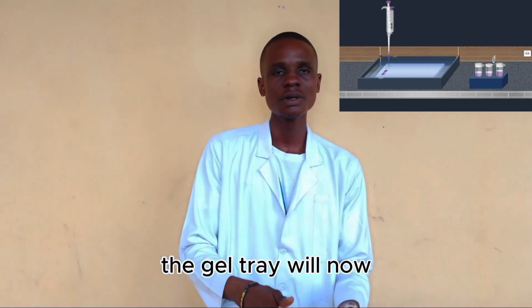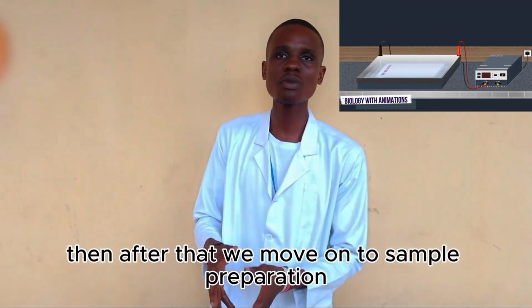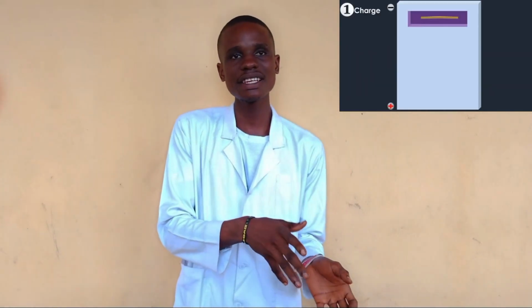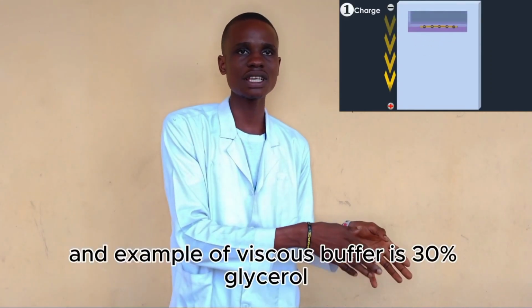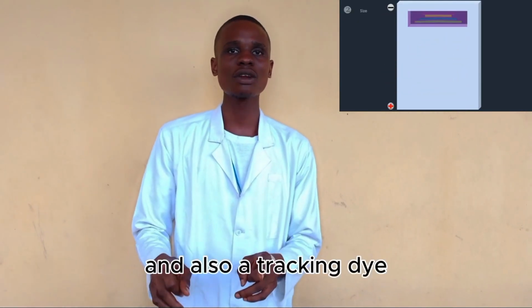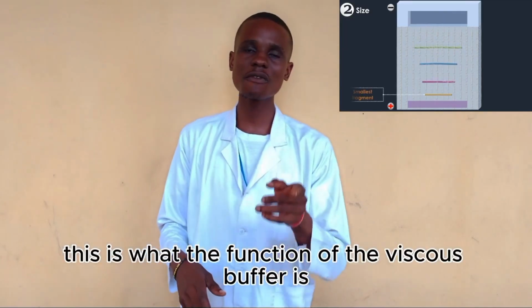Now, the gel tray will be transferred into the electrophoresis tank, and it will be covered with the buffer that was used to prepare it. Then after, we move on to sample preparation. At this point, the DNA sample to be resolved will be prepared with a mixture of a viscous buffer. An example of such viscous buffer is 30% glycerol and also a tracking dye. And one of the tracking dyes used is bromophenol blue dye.